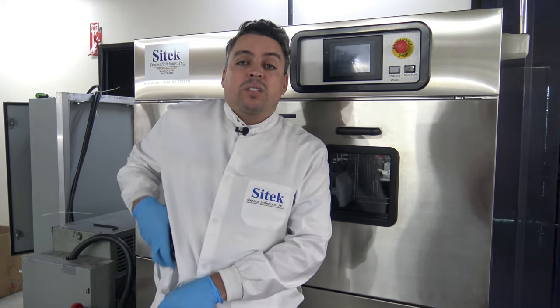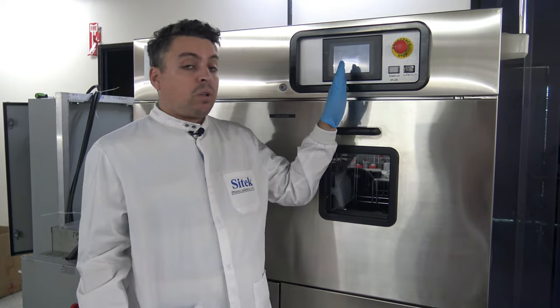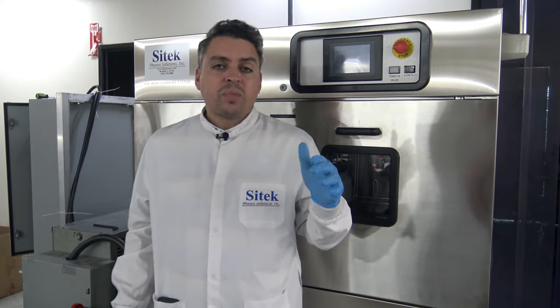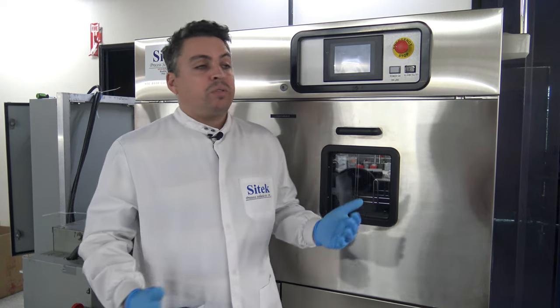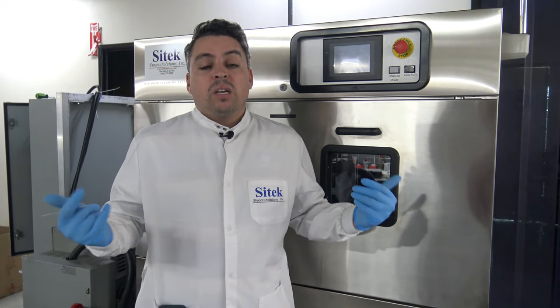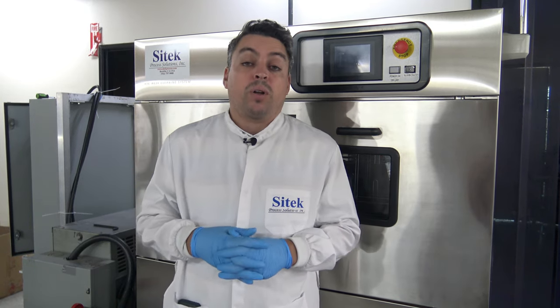What I'll do is review the system and discuss the refurbishment that we've done for it. Then we'll get the process started. I'll also do some controller review. At the end of the run cycles, we're going to pause the camera because essentially we'll be viewing it just sitting here drying for about 40 to 50 minutes. At that time, we'll cut the camera and come back in at the end so we can inspect the product and confirm that everything operated properly.